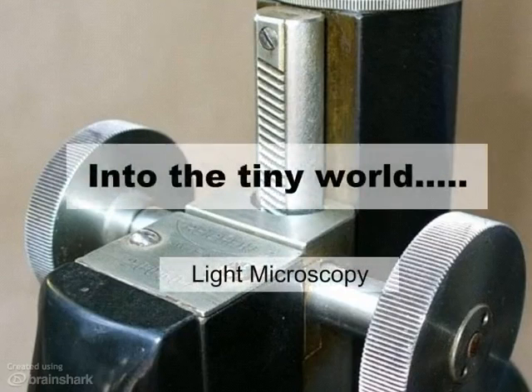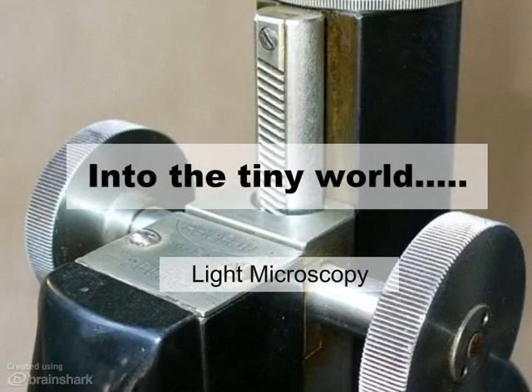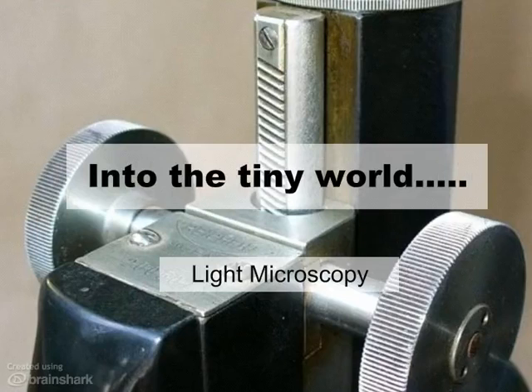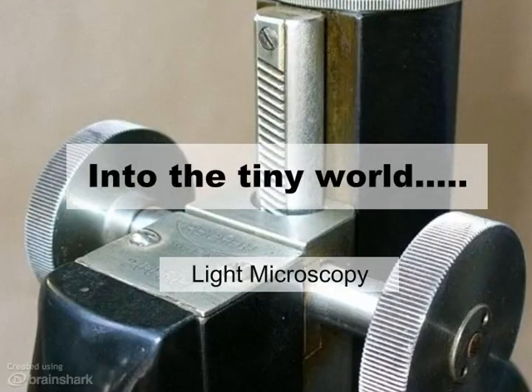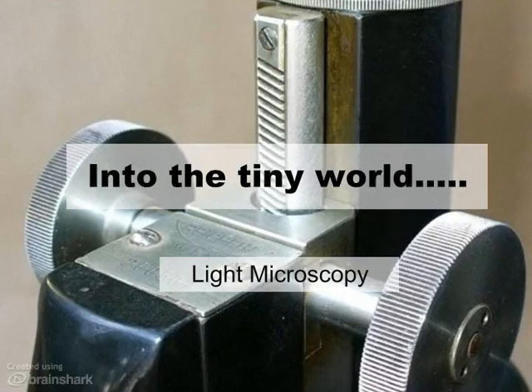The answer to number two is, of course, microscopes. In this video, we're going to be looking more at the compound light microscope that we're going to be using in labs. But of course, we'll review a little bit of the basics.